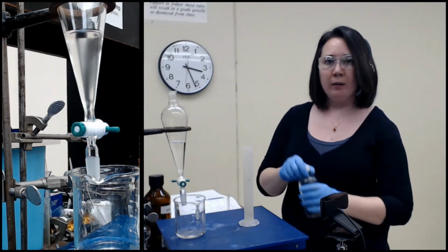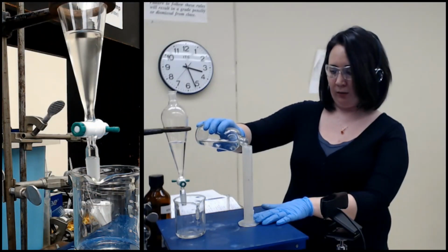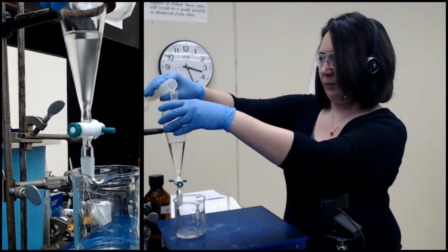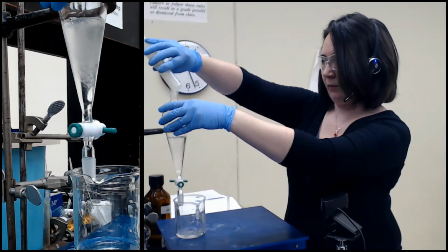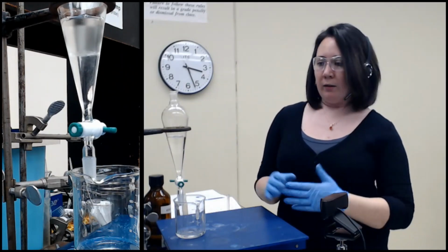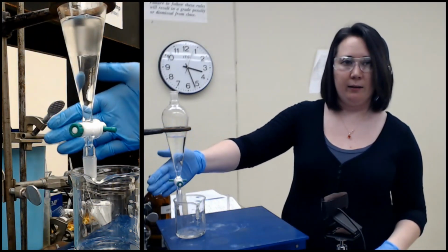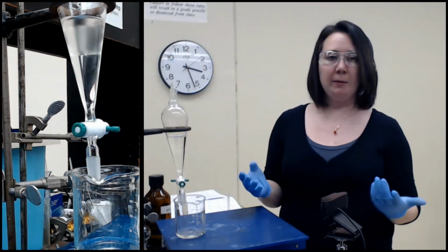So that's my first portion of sodium bicarbonate. Now I'm going to do my second portion. I'm doing about 15 milliliters both times. I started with 30 milliliters of ethyl acetate. After I mixed it, it looked a little bit cloudy from a little bit of an emulsion and also just the mixing here. It does look a little bit cloudy, but it's actually a little easier, I think, to see the line between them. Not when I cover it up, I guess. But I'm just going to repeat the process.